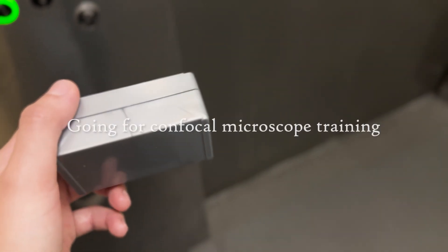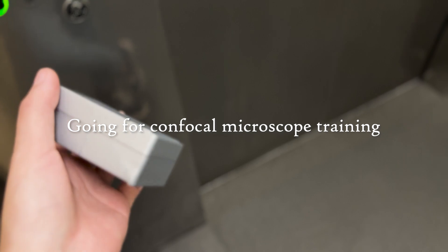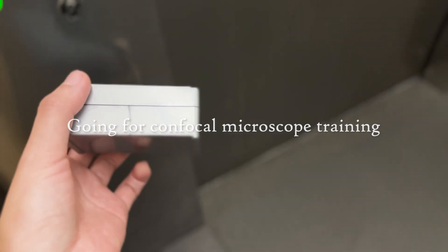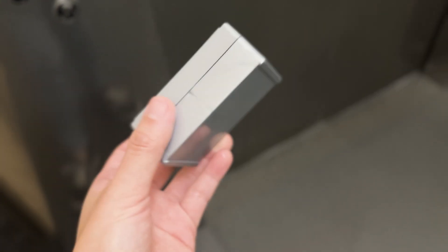So now I'm going to go to confocal. Today I'm having a training session, so the technician there will teach me how to use the confocal microscope to image my slides.